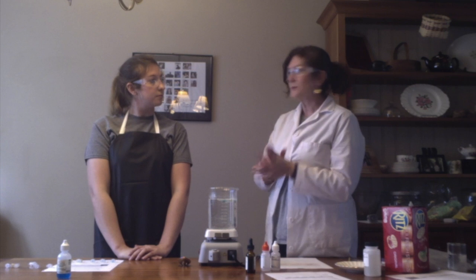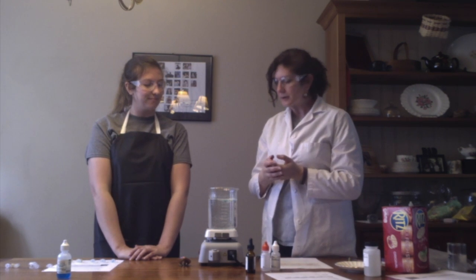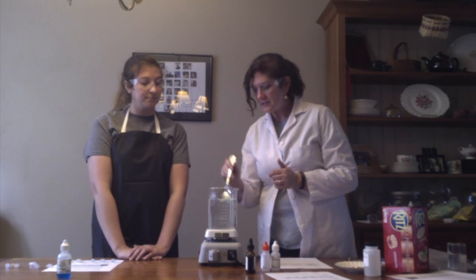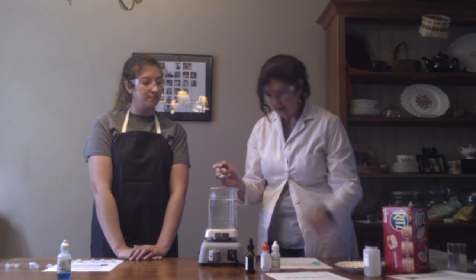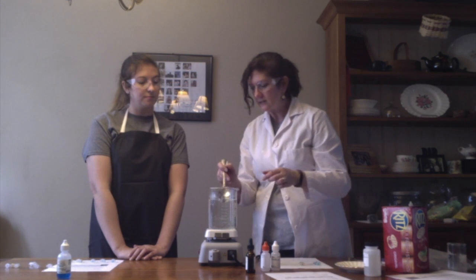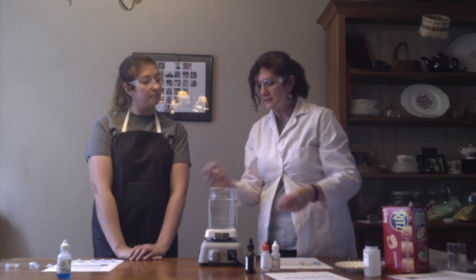All right, so through the magic of the internet, we've waited about 5 minutes here, a little more, and we can see a change in these tubes. So I'm going to go ahead and fish them out. And these are the tubes we had with the Benedict's solution in them. And our book tells us that Benedict's solution tests for simple sugars.